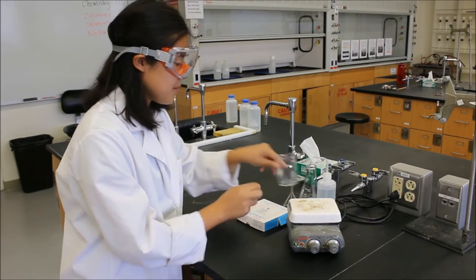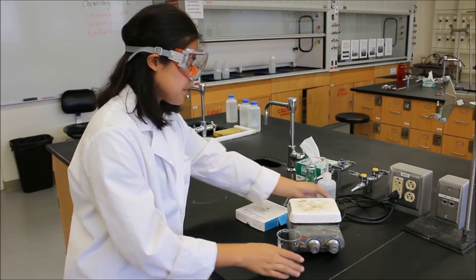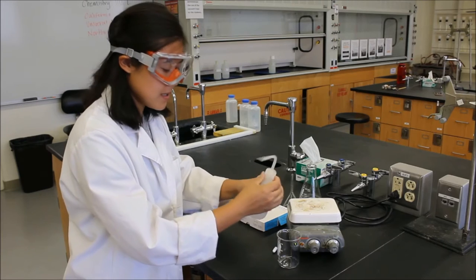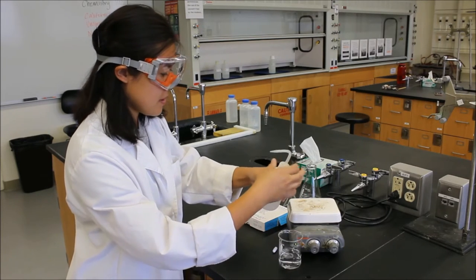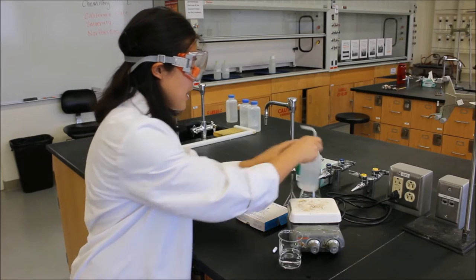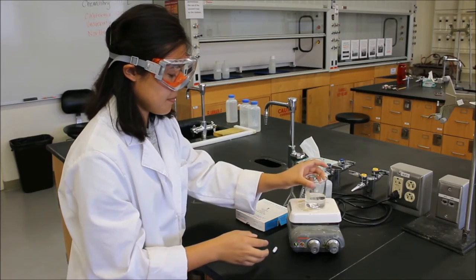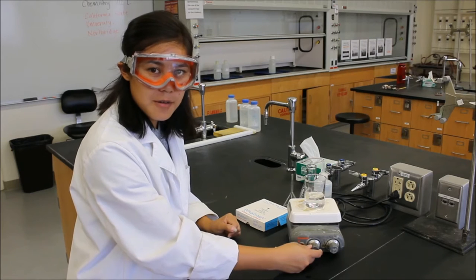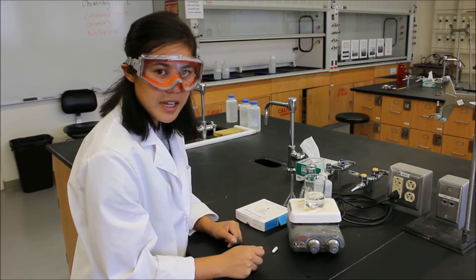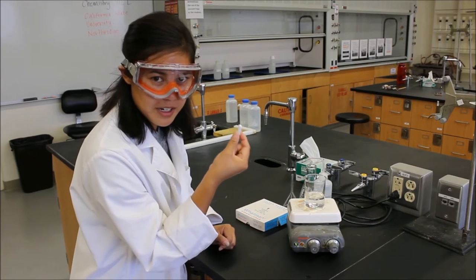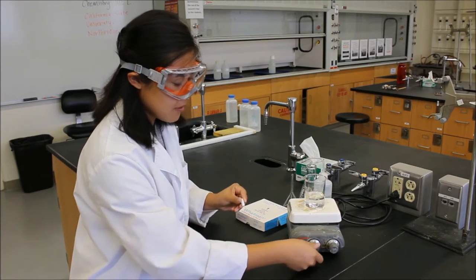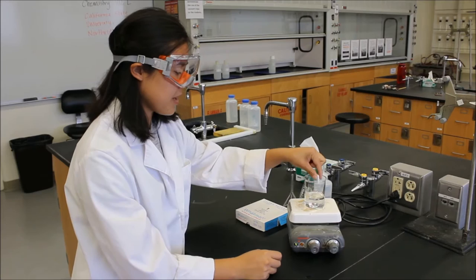So first we'll just fill a beaker with some water just for demonstration purposes. And we're going to go ahead and put it on the hot plate. If you notice right now we'll hit stir and nothing's happening. It's because our magic little stir bar is right here. And if you want to stir, let's turn this back down. You have to throw it in.